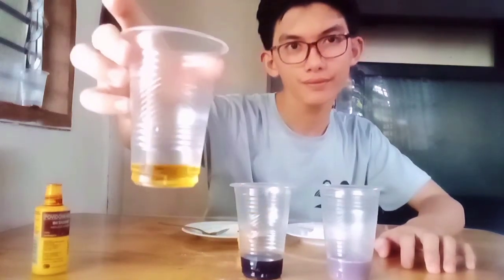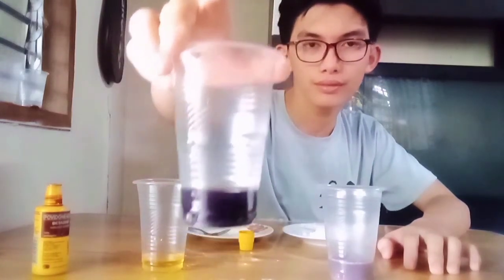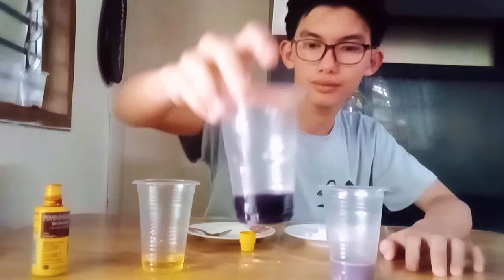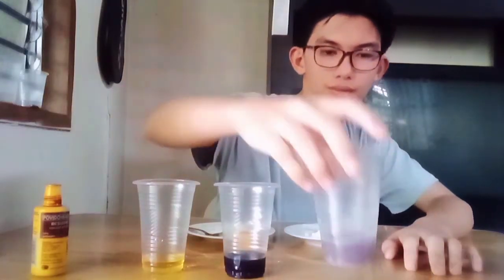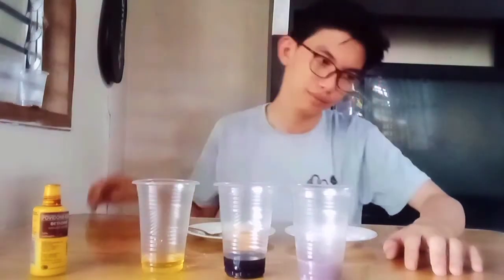And that will be the end of our home laboratory experiment. This is what an iodine solution in water looks like. This is what it looks like as an iodine test on starch solution for cornstarch and for flour.